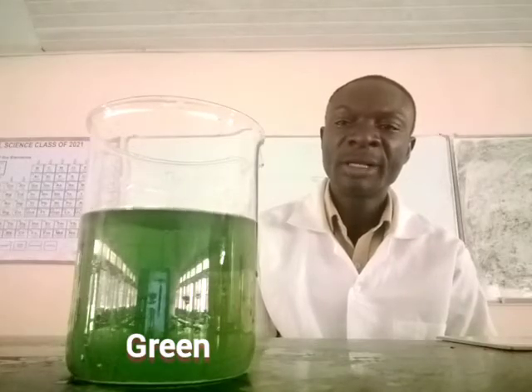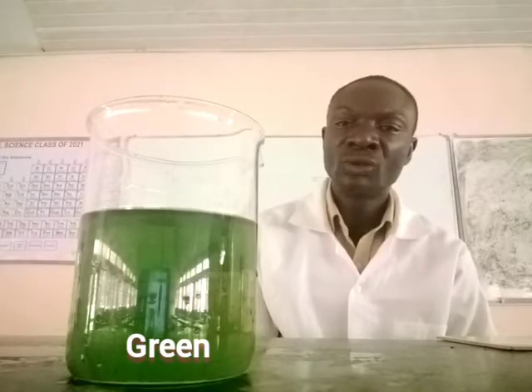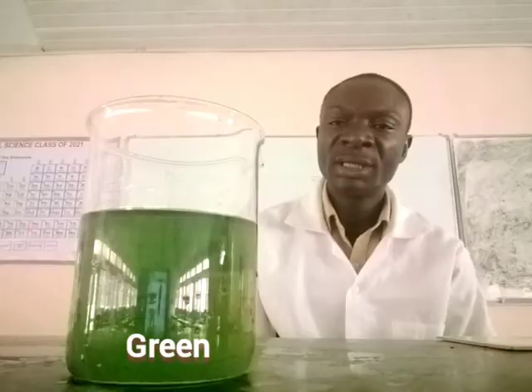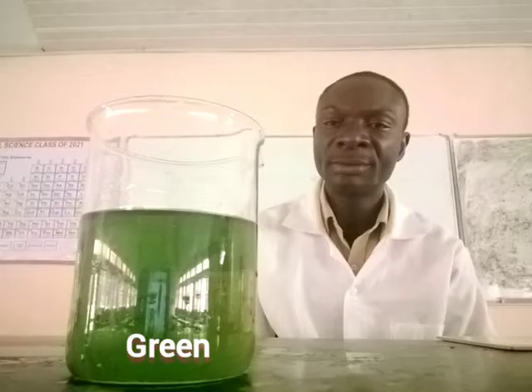Now the green color is getting lighter to turn to yellowish brown, because manganese 4 plus in dilute solution appear yellowish brown, but its actual color is brown.